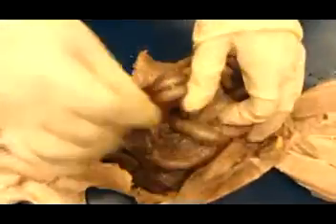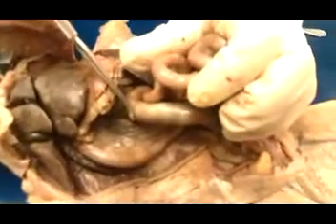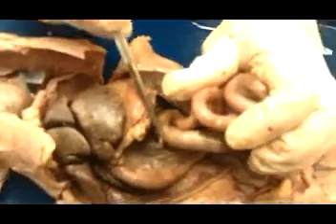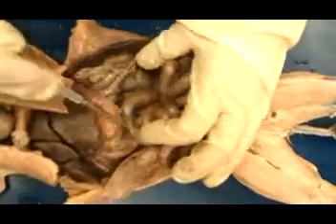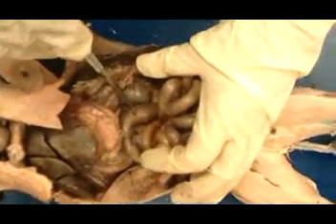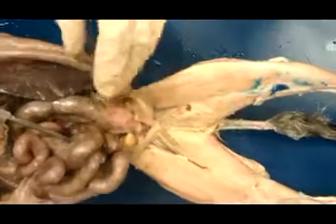Going back to the cecum, remember this is the blind-ended pouch of the large intestine. Where the ileum attaches, it would be the ileocecal valve. Then we have the ascending colon. Manipulate it a little bit. Ascending as it comes up, it bends here near the liver. That's called the hepatic flexure. It comes across to the left of the body. That's called the transverse colon. It bends again here near the spleen. That's the splenic flexure. And then it descends and comes down to the sigmoid colon and rectum.